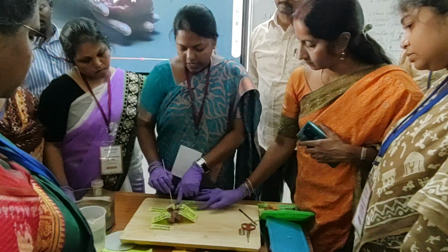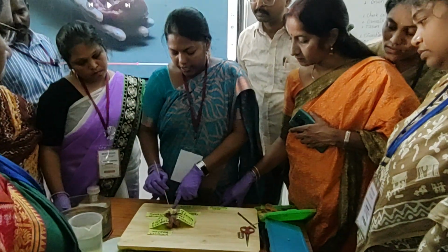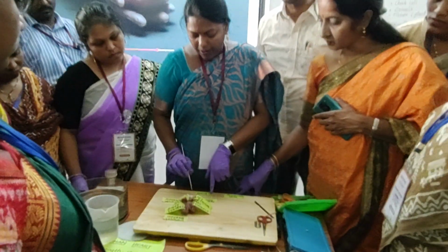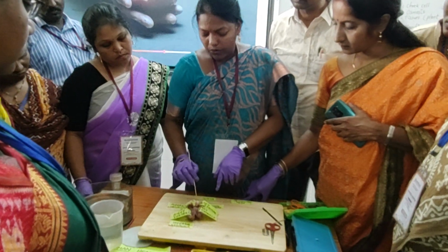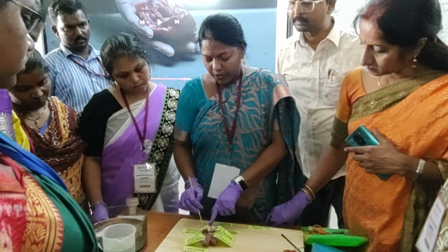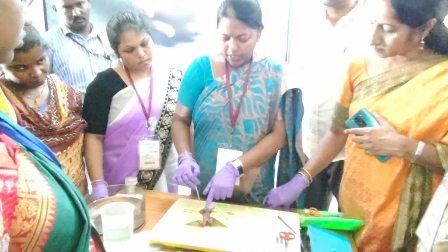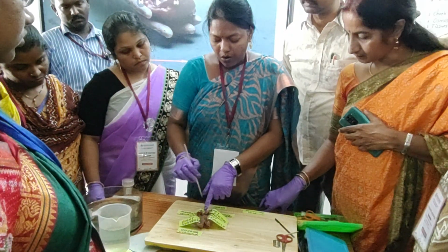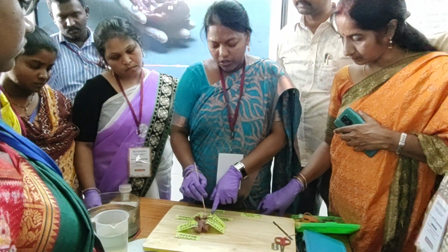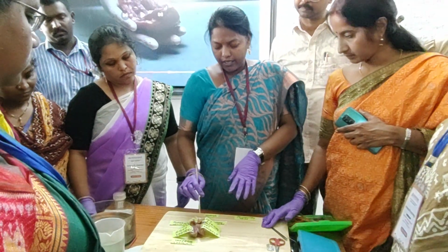The pulmonary artery originates from the right ventricle. The aorta originates from the left ventricle. And the pulmonary veins open into the left atrium and the vena cava opens into the right atrium. The right atrium receives the deoxygenated blood from all body parts except the lungs. The left atrium collects the oxygenated blood only from the lungs through the pulmonary veins.